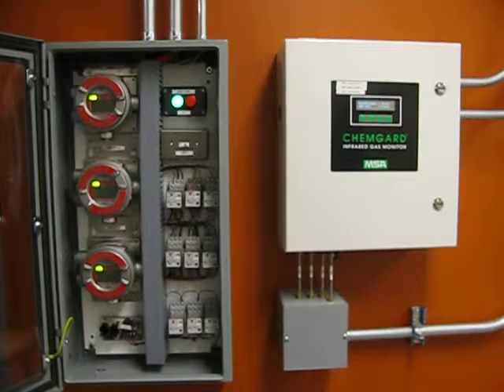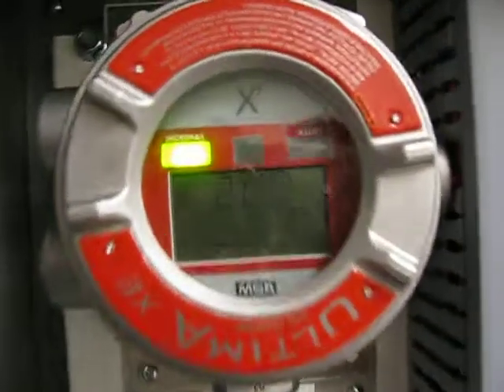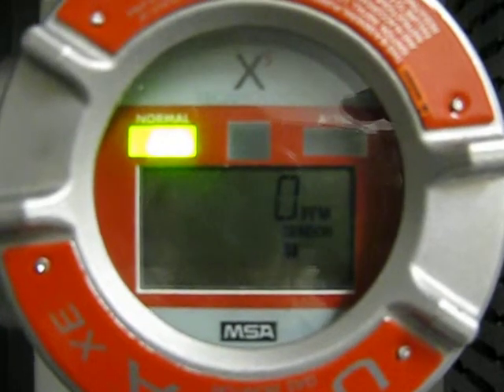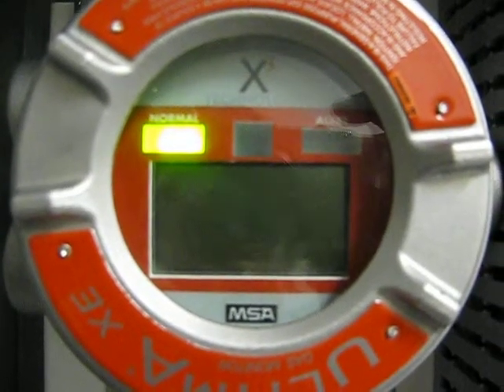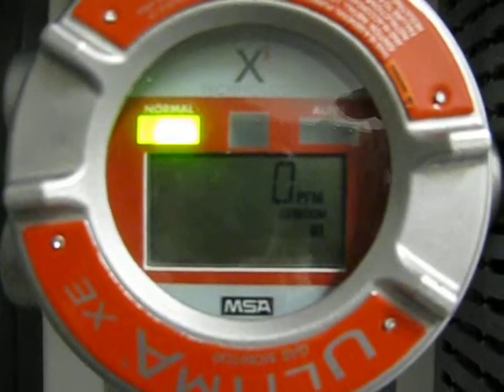These are the gas sensors in the clean room hallway. This is the sensor for the SAS, and there are three gases monitored by it. The first is ammonia, NH3, which shows zero parts per million. The next reading is for oxygen, showing 20.6% in the SAS atmosphere. The next sensor detects silane, which is also at zero parts per million.